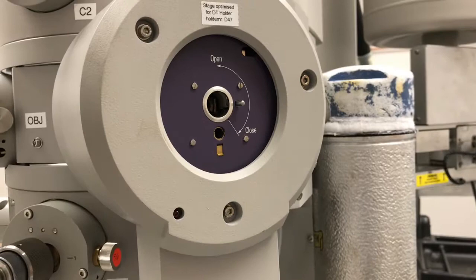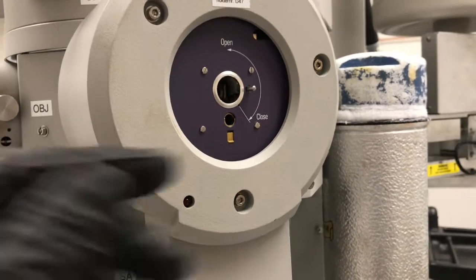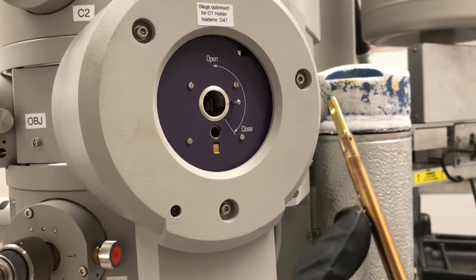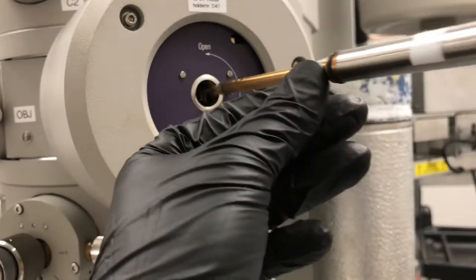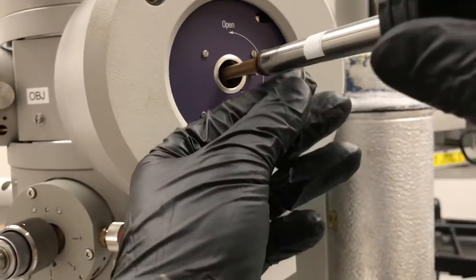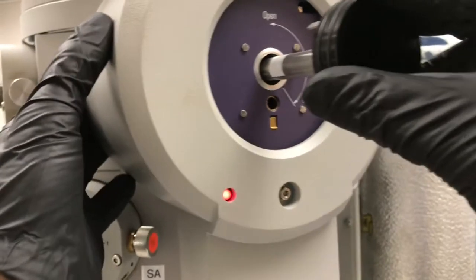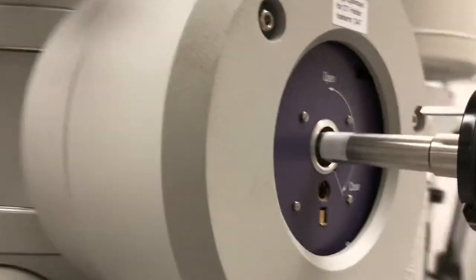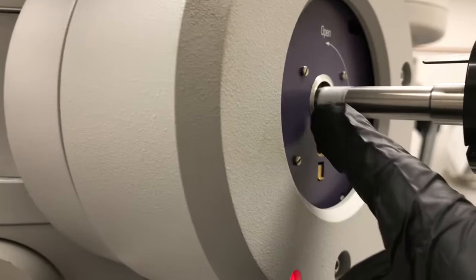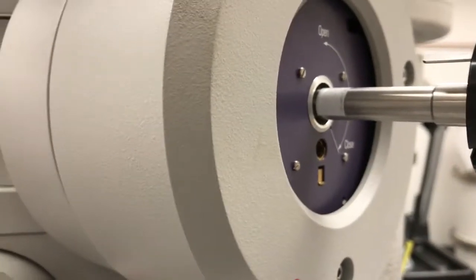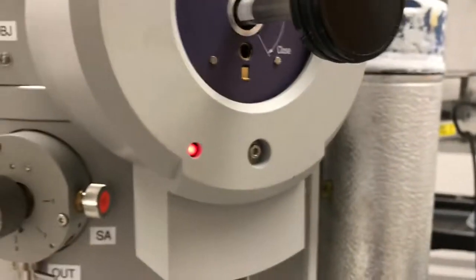Once it's in, you're going to let go. Then the airlock has to pump out. There's the pin, I'm going to line that up right there, resistance, push, and then let go. You can see if it's done properly it should go up to the edge of that tape line. Now you also just heard that airlock valve open.